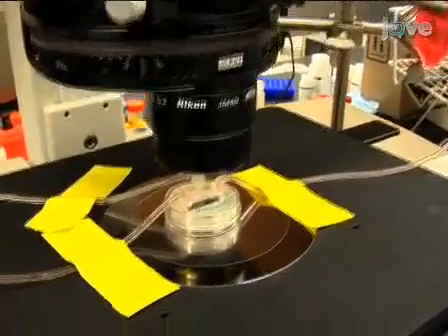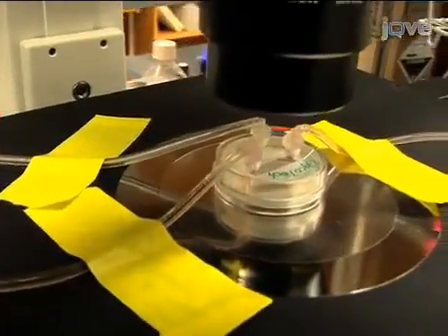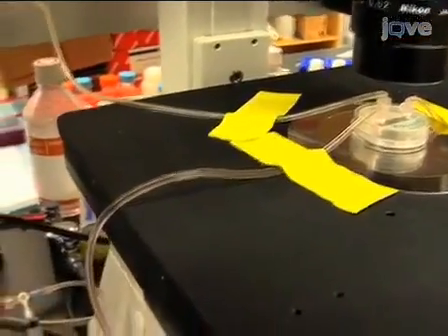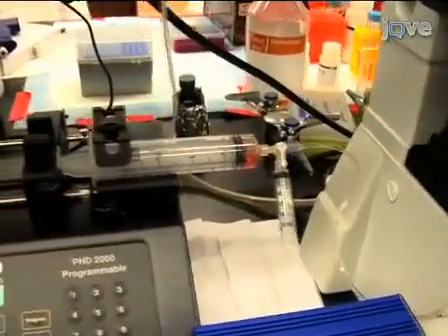Now secure the flow chamber to the stage with a piece of tape over each of the input, output, and vacuum lines. This ensures that the field of view remains constant when visualizing and collecting the data. The flow chamber is now ready for use. These steps should be repeated for each cell input run and for each new plate.